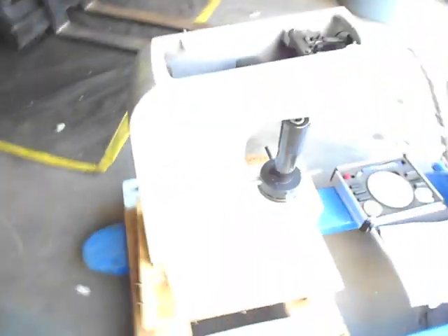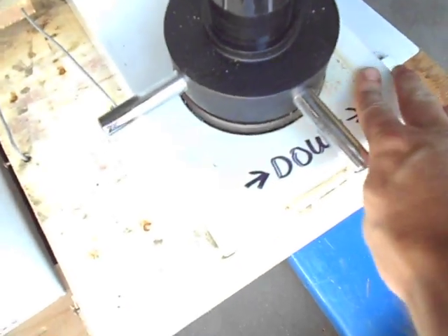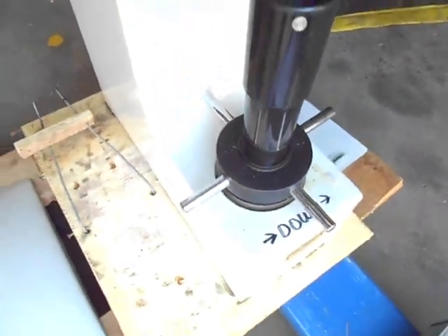You can see your little levers move when I turn the dial. And there we go, you can see the plunger drop. On this side you can see it raise back up. But it does look like it's got some damage here, so it's going to need to be repaired.